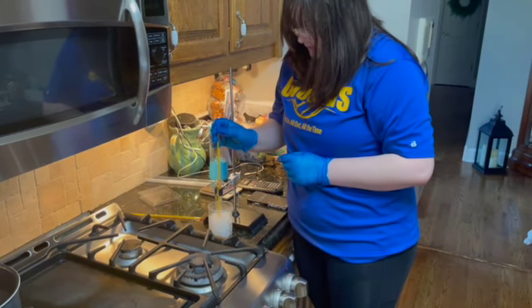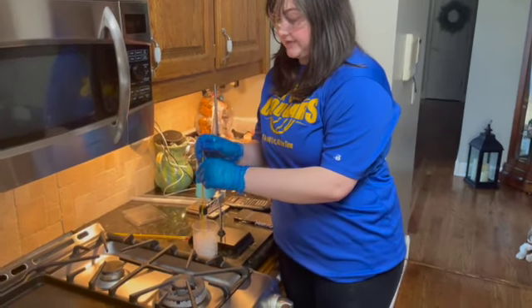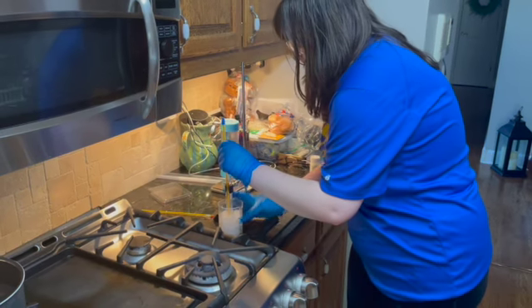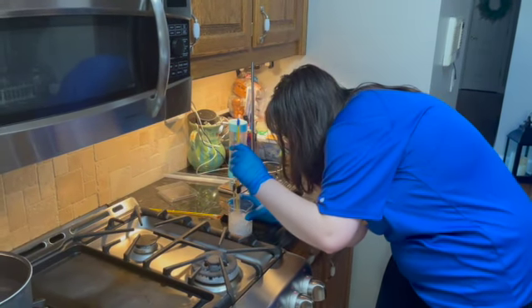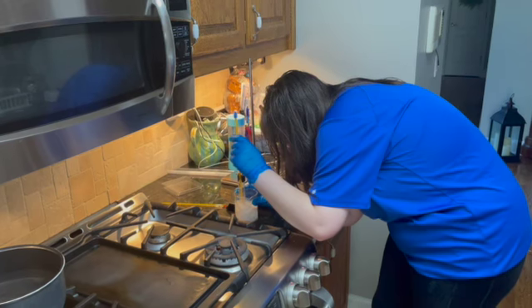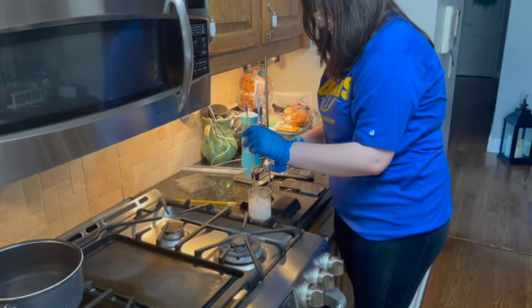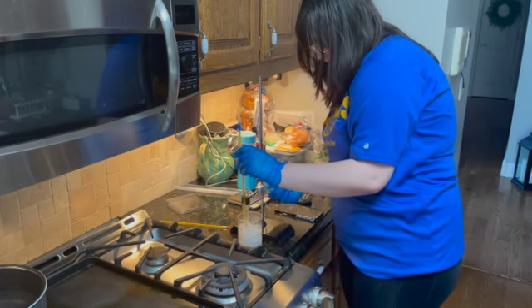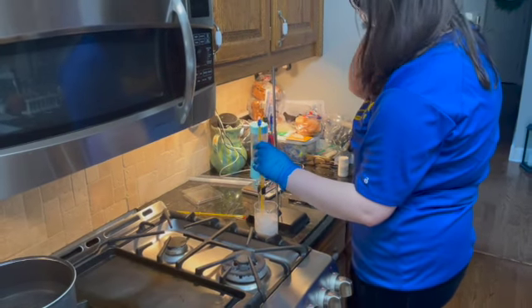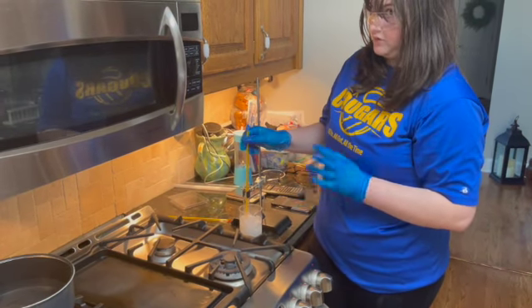While we're doing that, its melting point is at roughly 53, 54 degrees Celsius, so it hasn't moved that much in the matter of 2 minutes. Looking at it, a good amount, especially around the sides, have hardened at this point and have gone back to their white texture. Looking at it as close as I can, it looks like it is crystallizing. So it's trying to get back to its original state before we even melted it, looking more crystallized than anything.